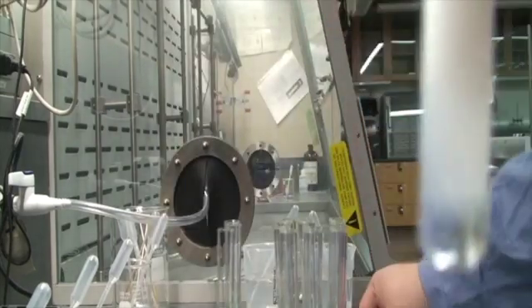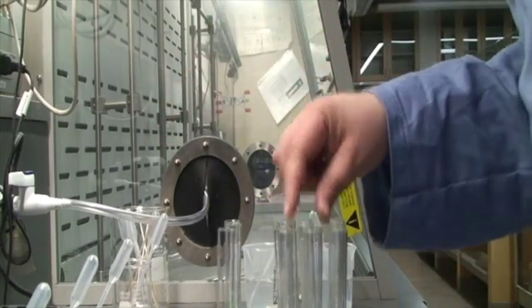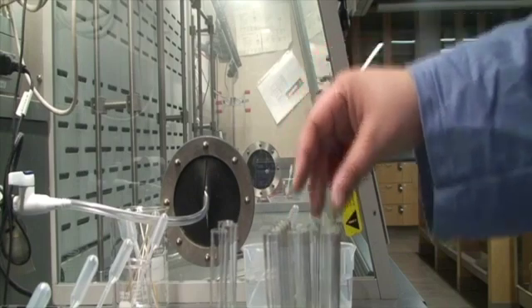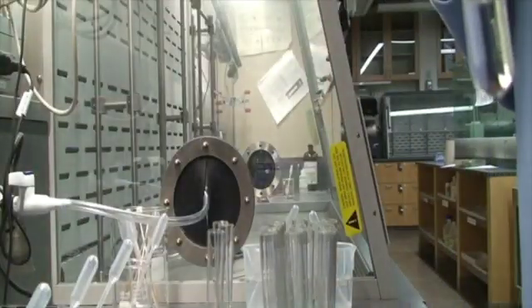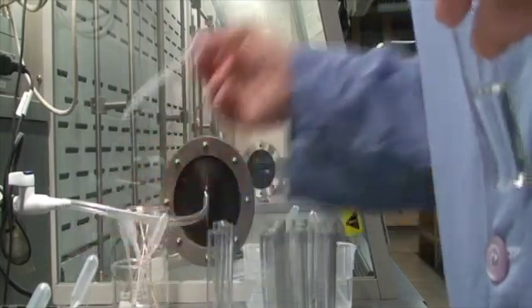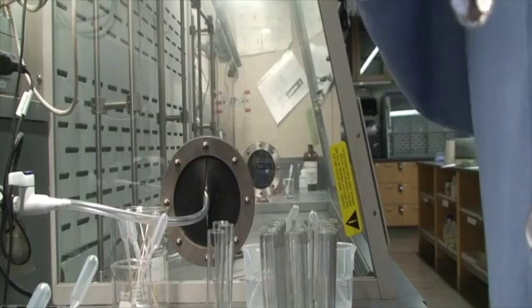Doesn't feel warm. No smell. Alright. Let's do 9 and 13.